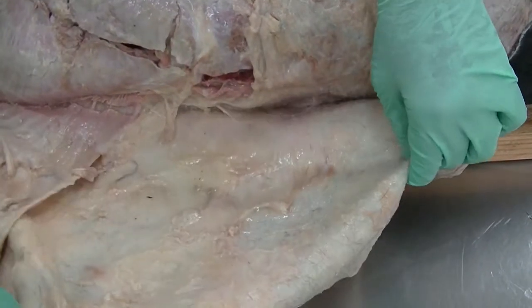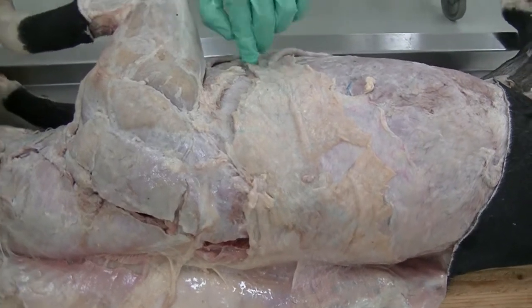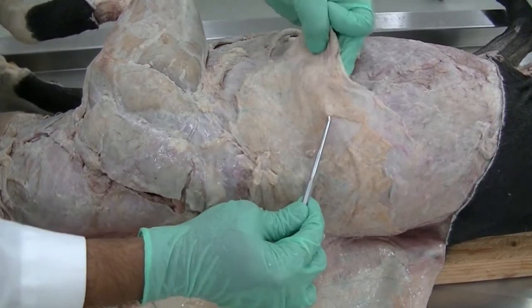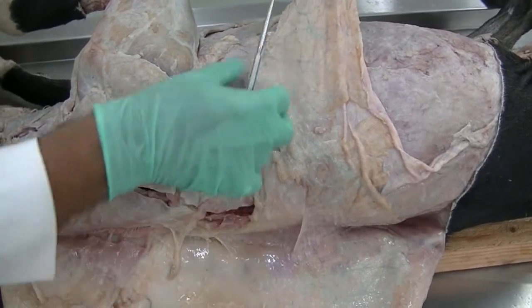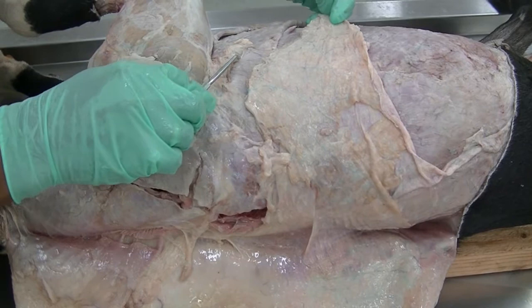We have part of the cutaneous trunci, which is the superficial muscle of the trunk, which basically is present between the two layers of the superficial fascia, which can be seen here, with some fat deposited on both sides. So the muscle is completely present within the superficial fascia. That is your cutaneous trunci, which has been transected here.